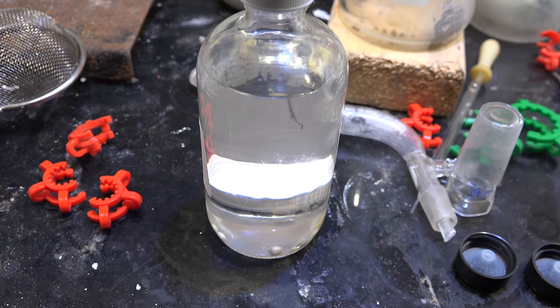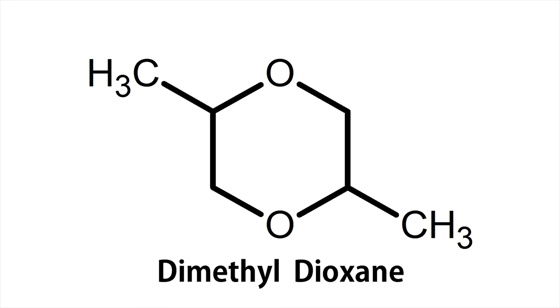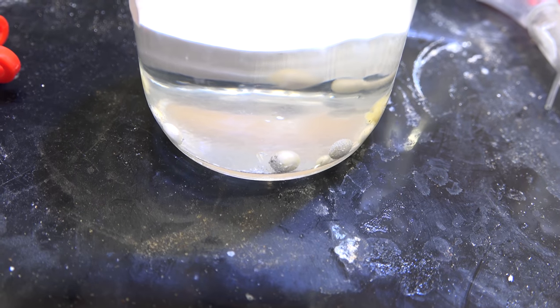And there we have it, dimethyl dioxane. Now there isn't much data about long term storage but just from looking at it I think it's a strong peroxide former so I strongly recommend storing over sodium if you don't have an immediate use for it.